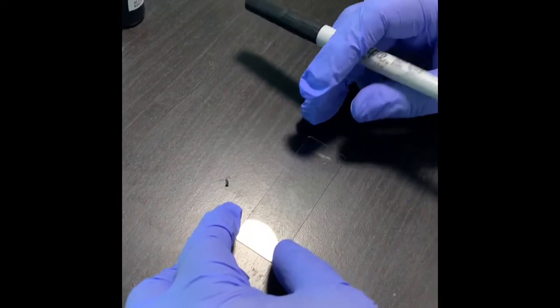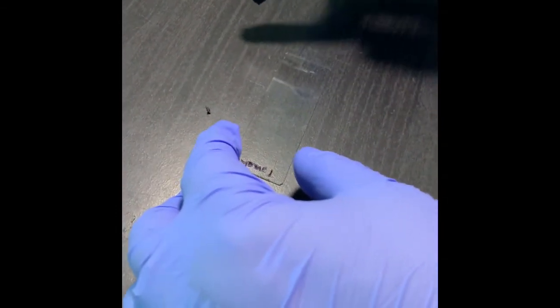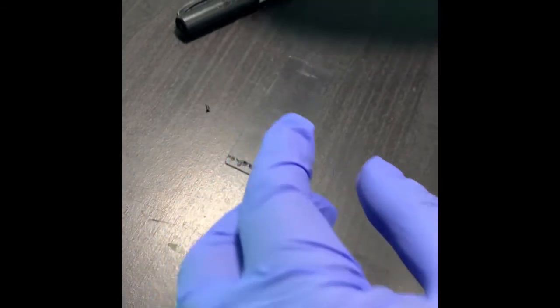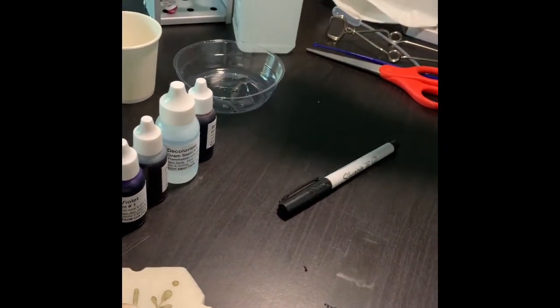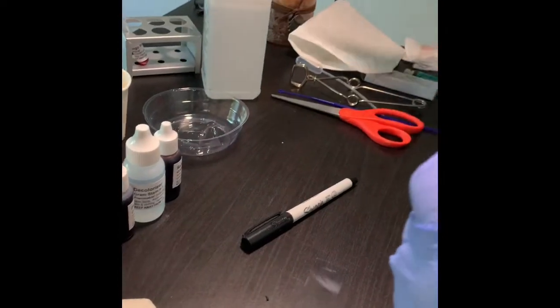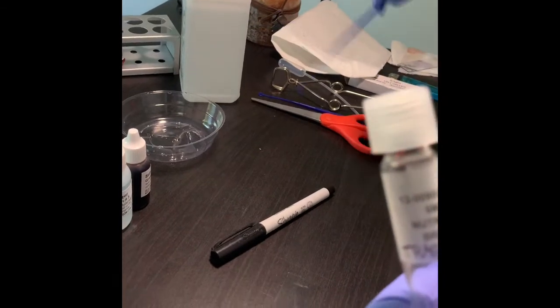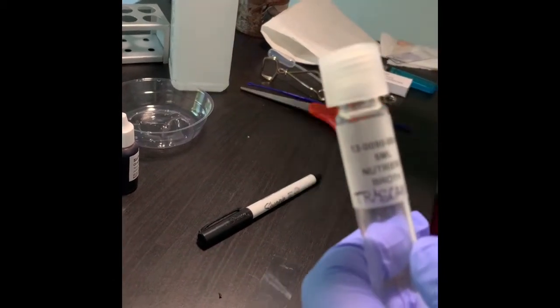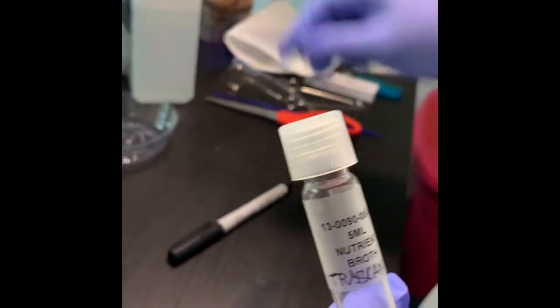So this time also I'm not drawing any circle or anything. I will try to spread it as much as is possible. So I'm taking my culture from the trash can and taking the inoculation loop, which I have disinfected with alcohol, and let me get rid of the excess alcohol and make it air dry. I have to make sure that it is dry, otherwise it will kill the microorganisms.